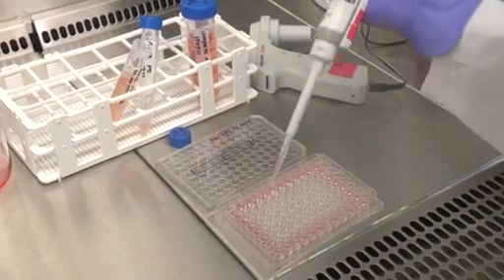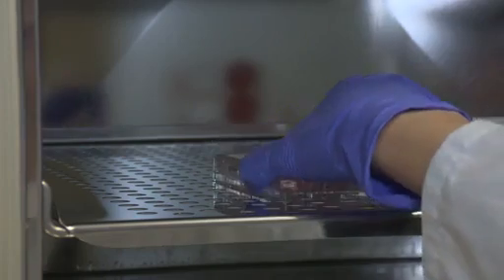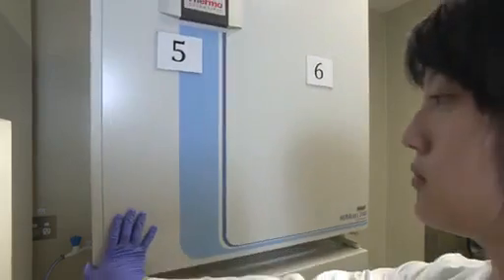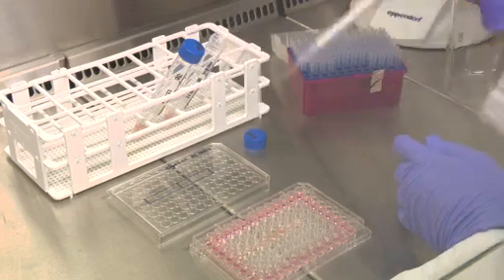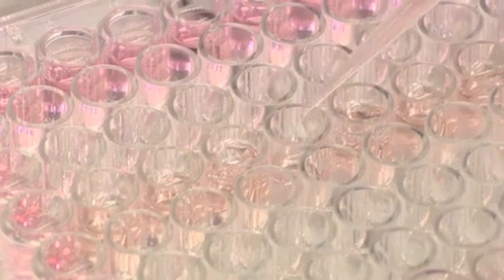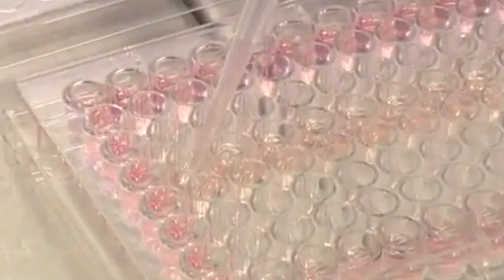The stromal cells are then harvested and plated into standard in vitro culture plates. After incubation for a few days, cells are treated with an adipogenic differentiation medium. Cells are incubated for 14 days with regular media replacement.